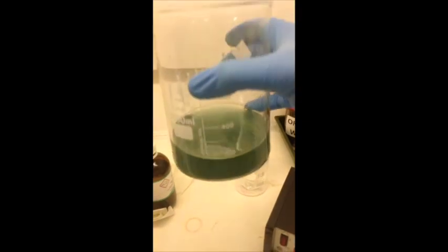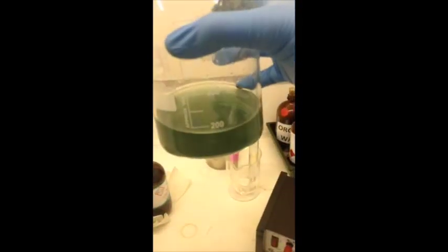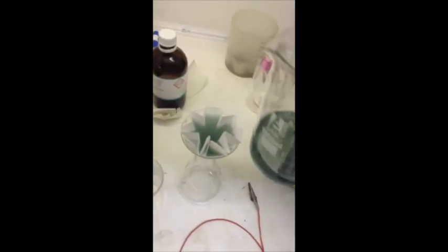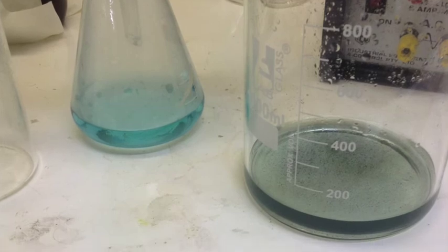At this point the solution will become coloured as the copper sulfate solution is produced. The true copper sulfate colour will only develop once filtered and the particulate material has been removed.